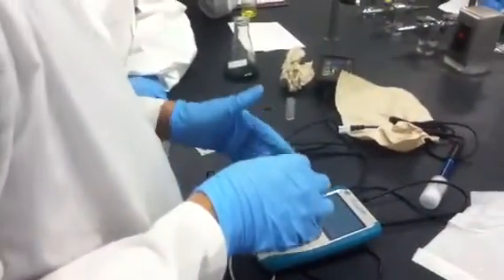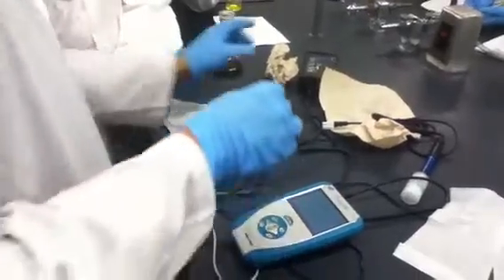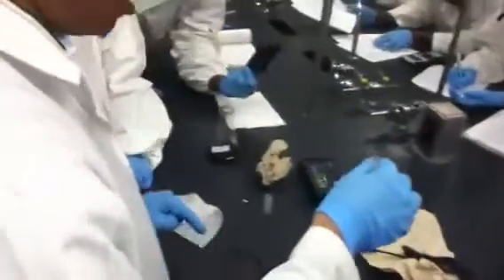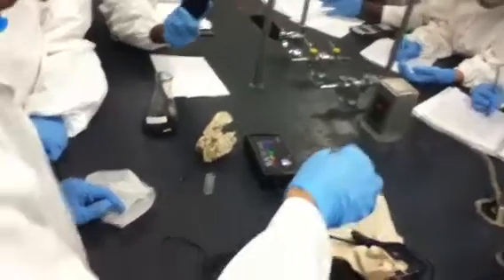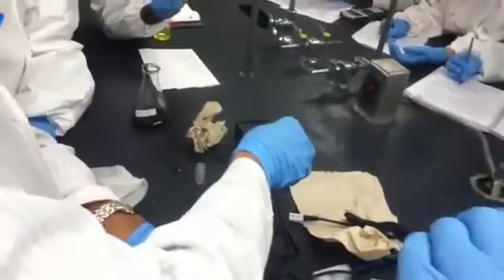Is this the toluene, right? Yes. Okay. So it will take a few seconds, 10 seconds more. Then we can put it in. So everything goes up here. This is the spectrophotometer. That's what does the measurement in this case. This is the detector here. So let's put it in there. Okay, it says complete, and then place a blank cuvette in the device.